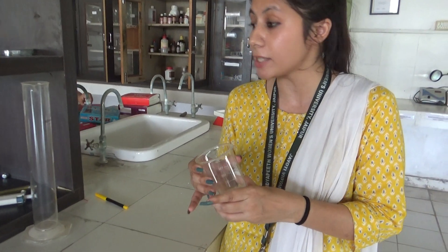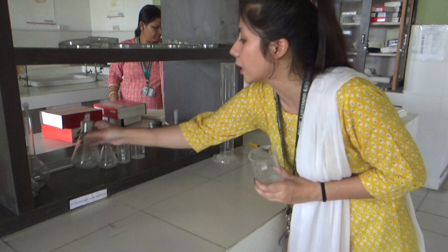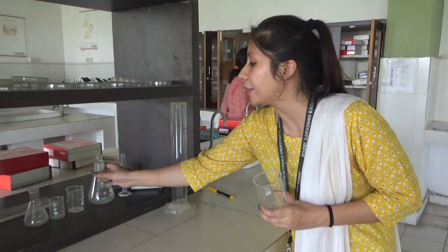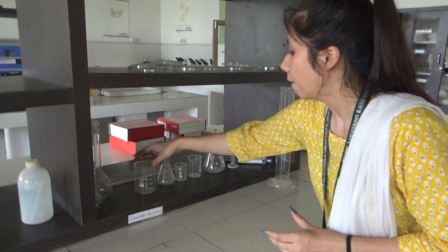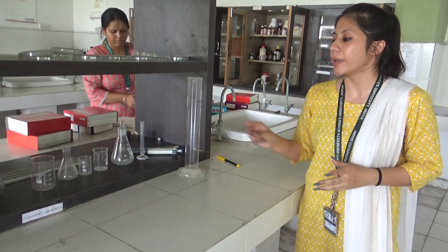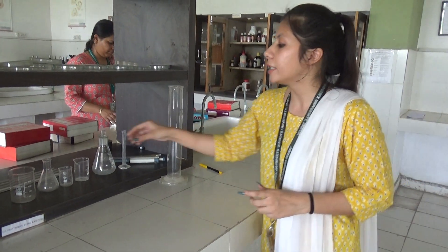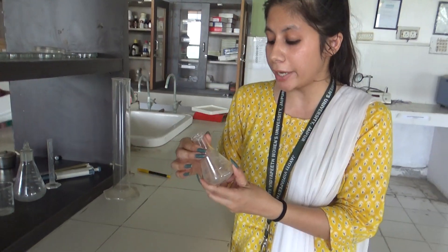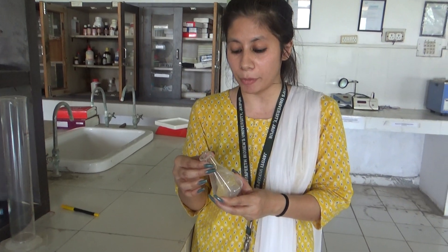These are another glassware — flasks. These are available in different sizes. These are the conical flasks that are used for transferring liquid solutions and boiling the solution in the laboratory.